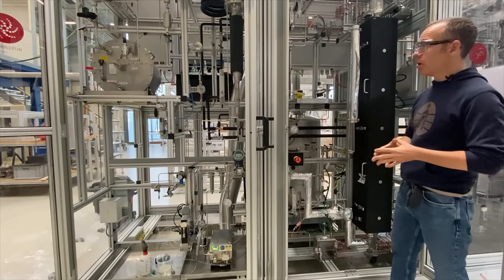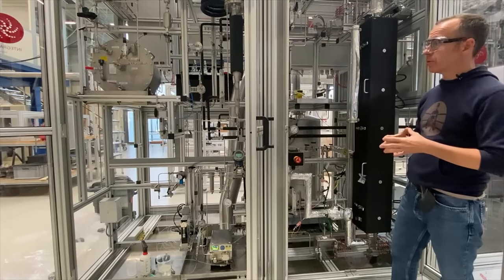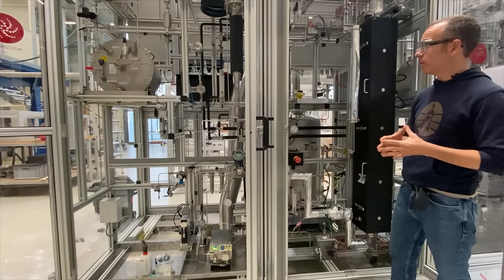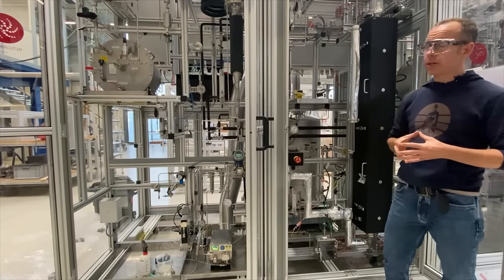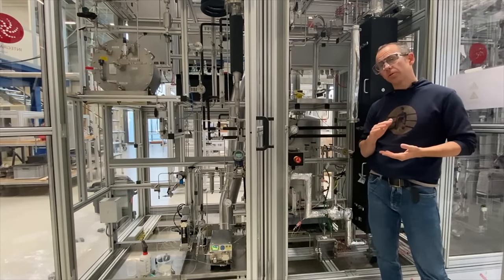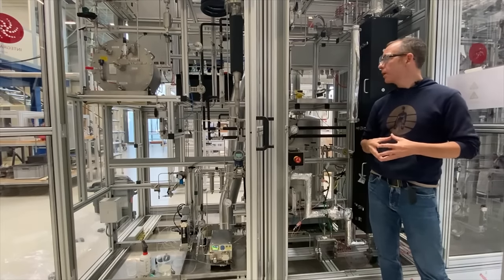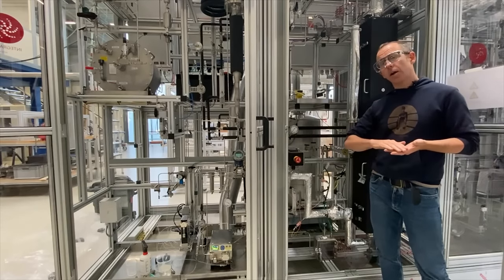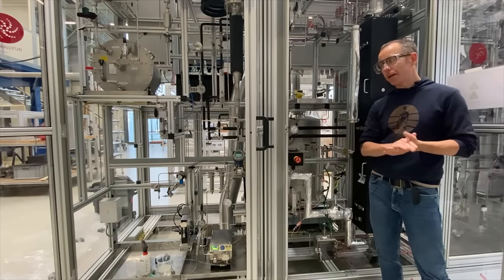As usual, we measure all of the off-gas on the other side with a Ritter gas meter, so we know the volumetric flow rates coming off. We also have the ability to collect all of the liquid samples here at low temperatures, because we have fairly low boiling components, and all of those liquid samples can then be subsequently analyzed offline by the client.